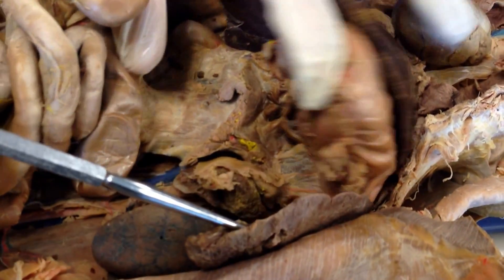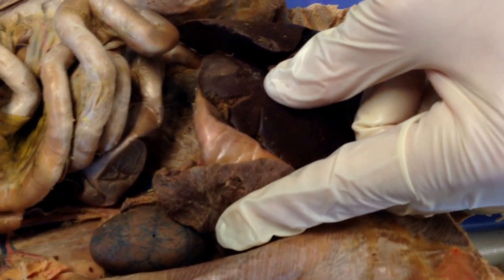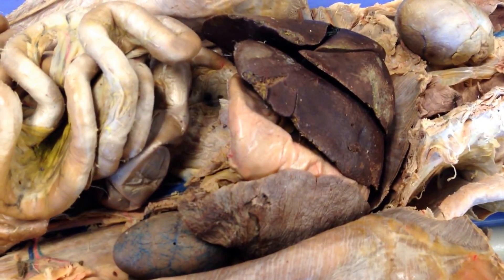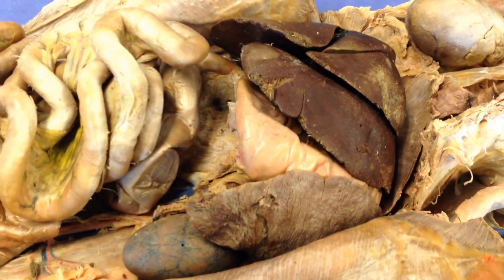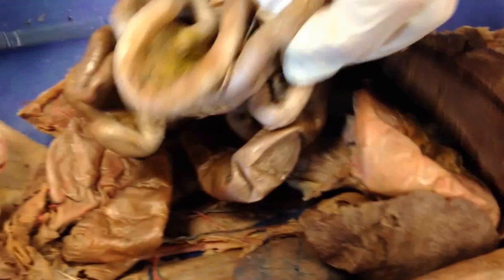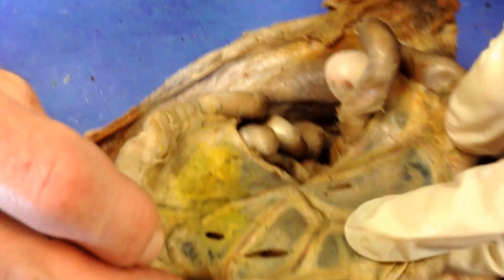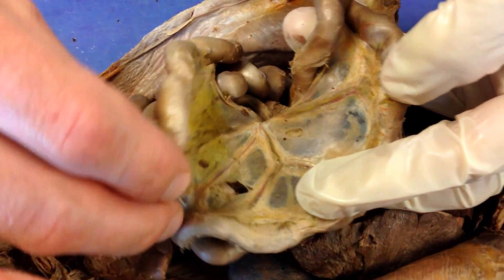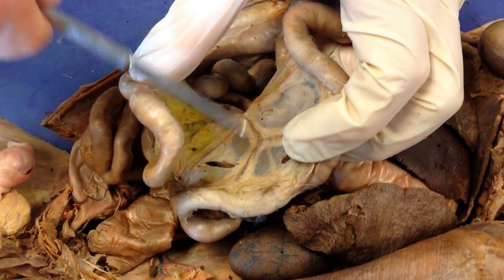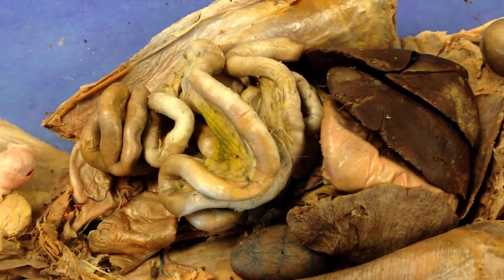Over on the side is the spleen. It kind of wraps around — it's almost like an arm wrapped around the stomach on that side. Those are the big pieces of the digestive system. One more to mention: the mesentery. Remember, the coils sit between sheets of the mesentery. You can see those mesenteric arteries and veins — the red and the yellow — flowing through there. All right, that's it.